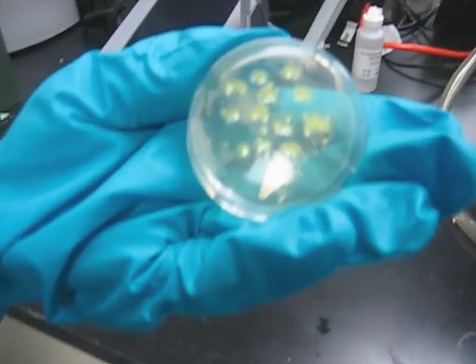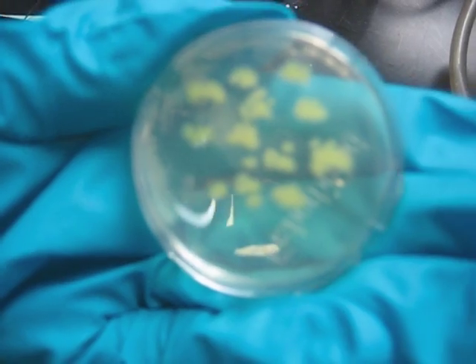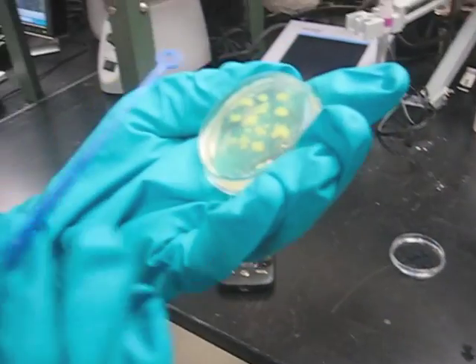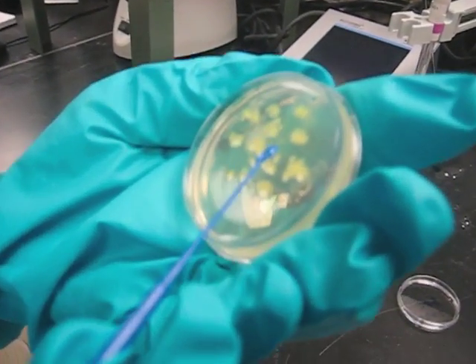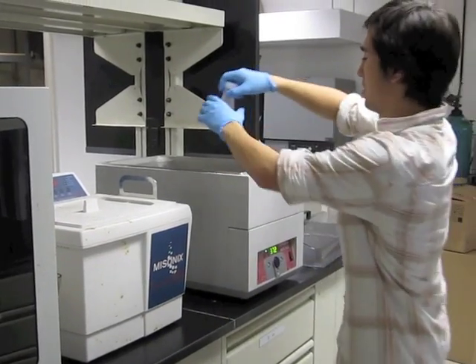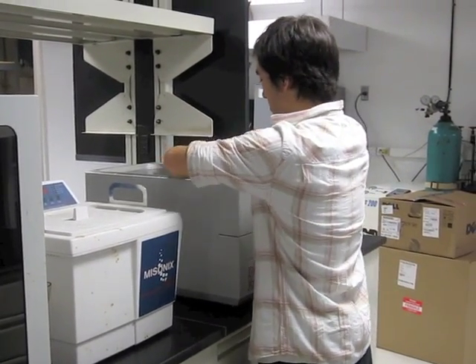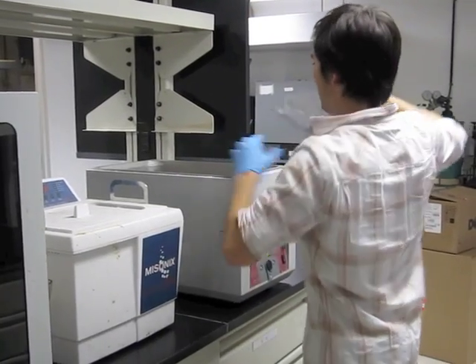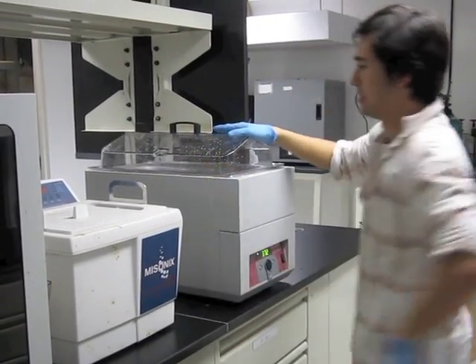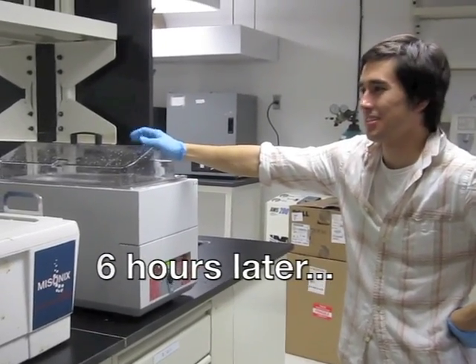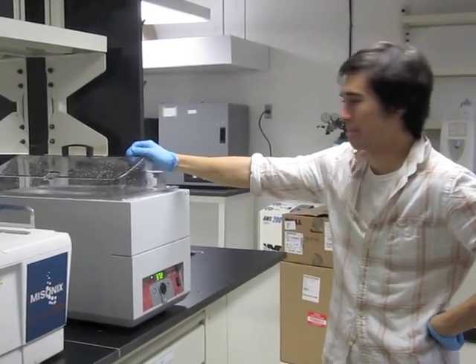After 18 hours, the plates were moved to the refrigerator for the weekend. Next, we moved the bacteria from plates to broth. We allowed the bacteria to grow for 6 hours in a water bath.